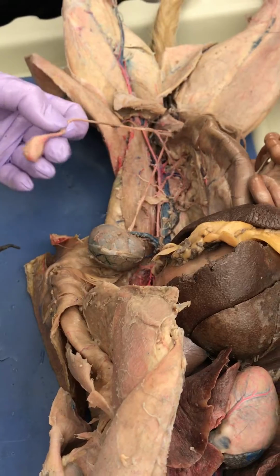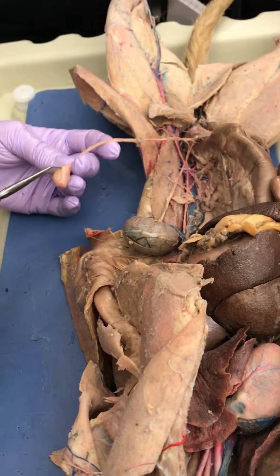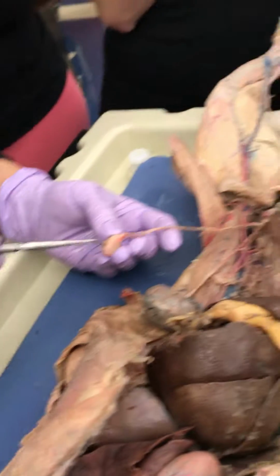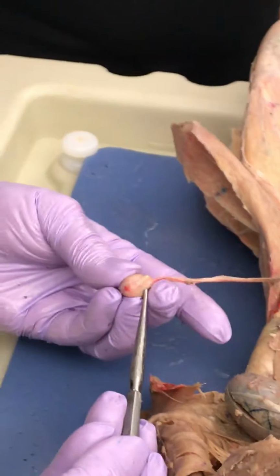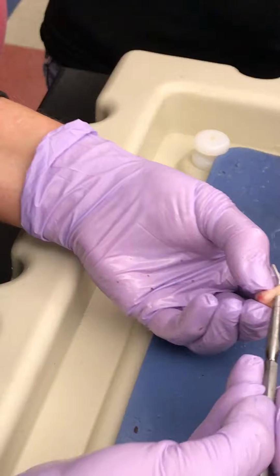Okay. So we had a male. Just saw this laying here, so I figure we'll do something with that. What's this? Testis. And then the testis has this thing. Epididymis, yeah. Could almost make it through. Let me see if I can. I think we did the other one. Hold on. That's already done.